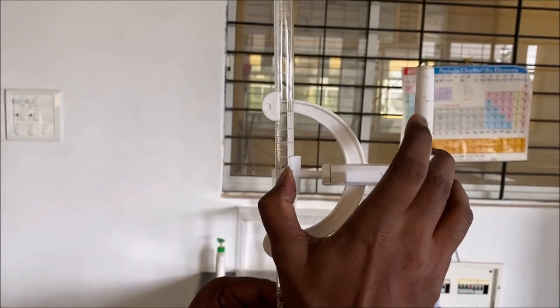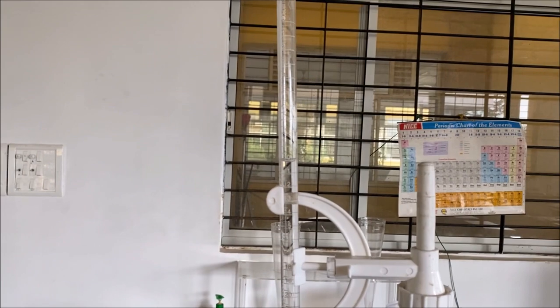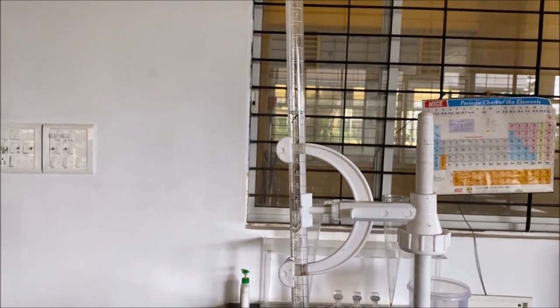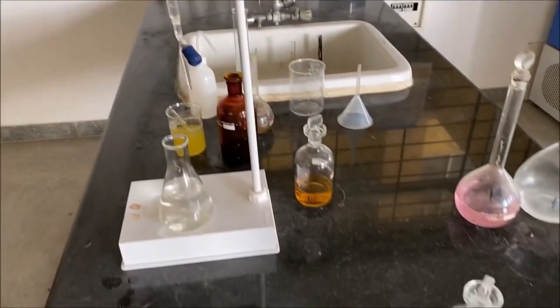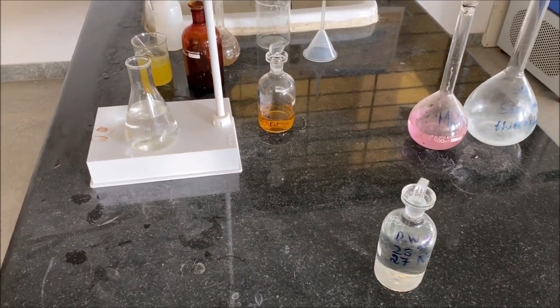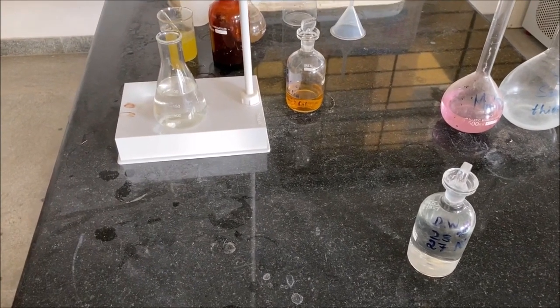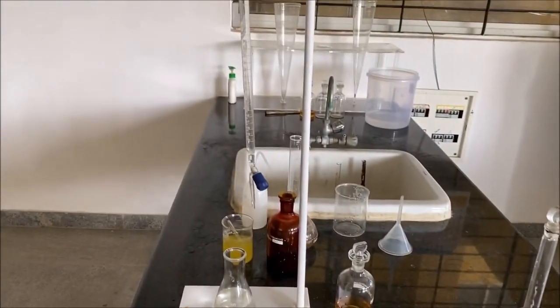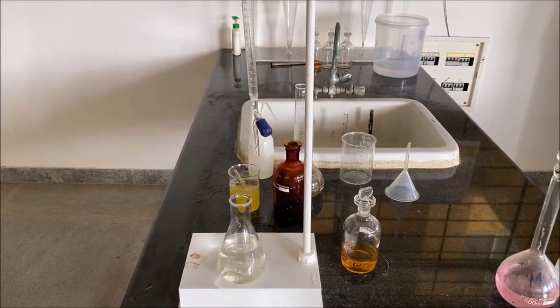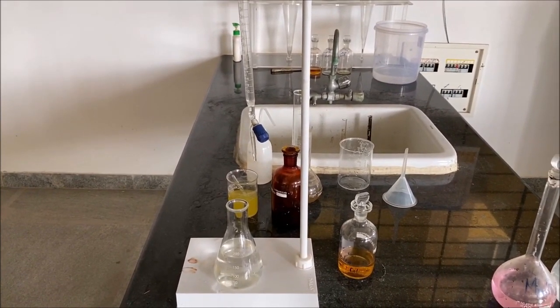At this point we are going to note down the burette readings and do the dissolved oxygen calculation for the two BOD bottles which were kept in the thermal chamber. You are supposed to use this calculation for the determination of biochemical oxygen demand by considering it with respect to the previous calculation, and utilize the formula available in the lab manual for the calculation of biochemical oxygen demand.